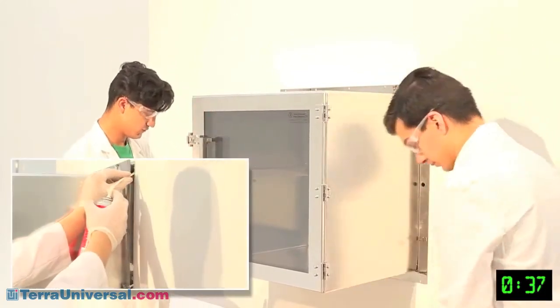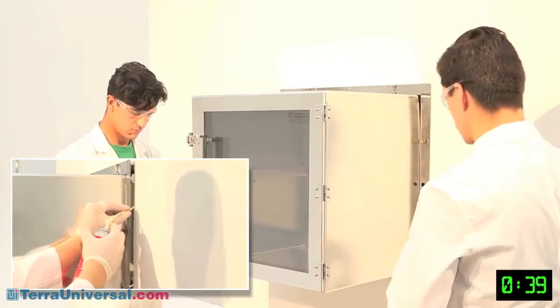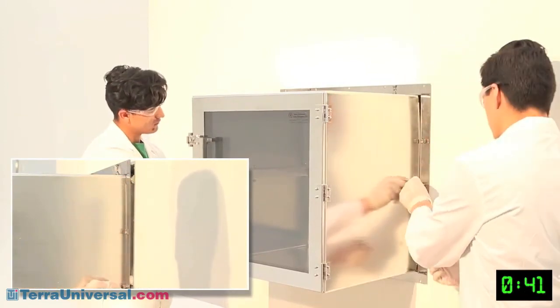Although the brackets provide ample structural support for the chamber, you may wish to fill the void with Expansion Foam.